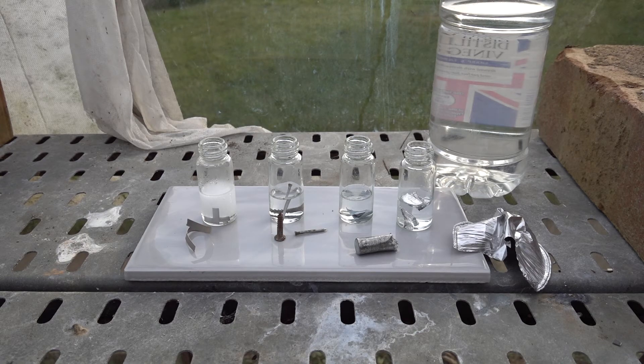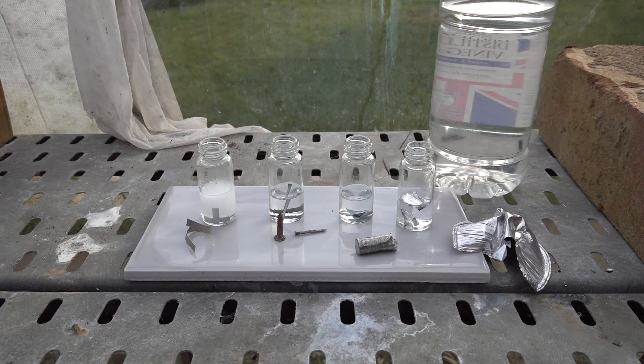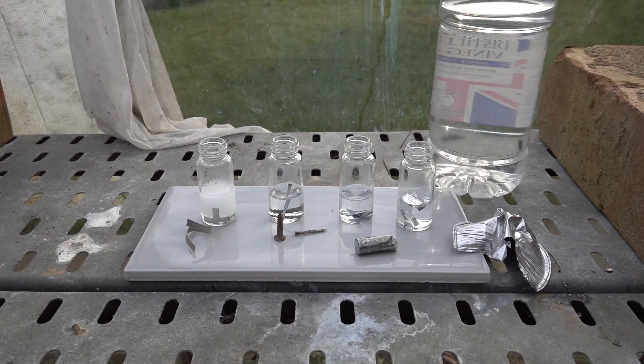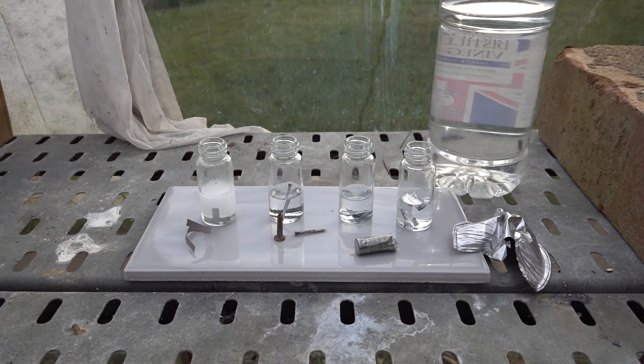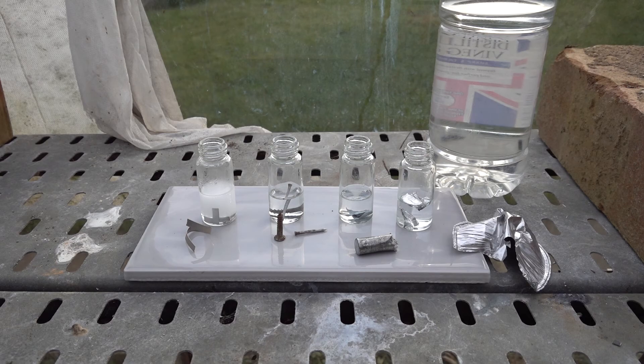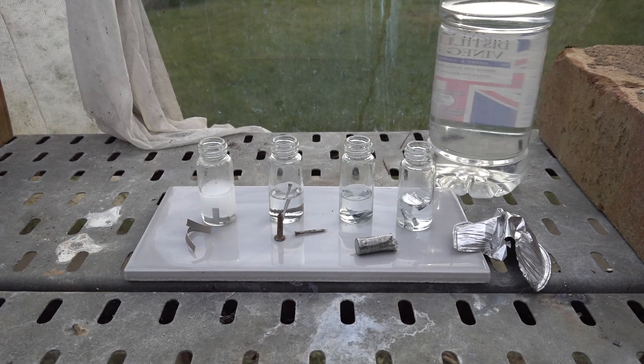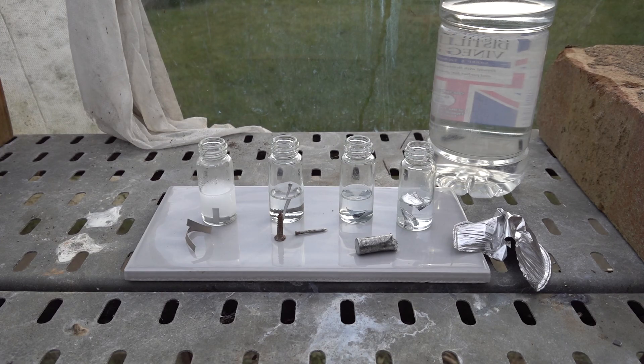Well here are our four metals having reacted for about five to ten minutes with the ethanoic acid and really not much of a change. The magnesium still bubbling rapidly, but the iron, zinc and aluminum not showing much at all. If anything, it's the zinc that is showing very, very small bubbles. But without a close-up, you won't be able to detect those, I think. So we need to leave the reactions going for rather more time.